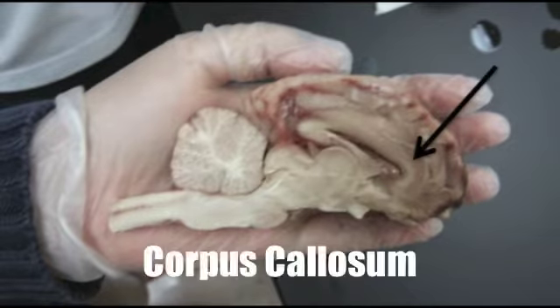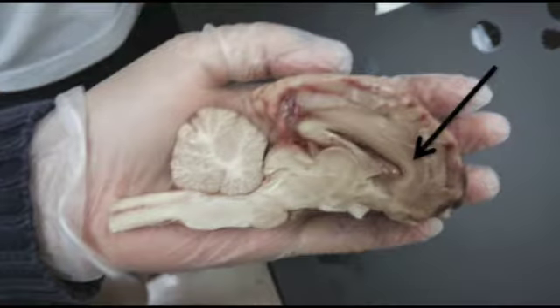The corpus callosum is a thick band of nerves that connects the right and left hemispheres of the brain together. This is the largest area of white matter in the brain. All the myelin facilitates very rapid transmission of information. It transfers motor, sensory, and cognitive information between the brain hemispheres.